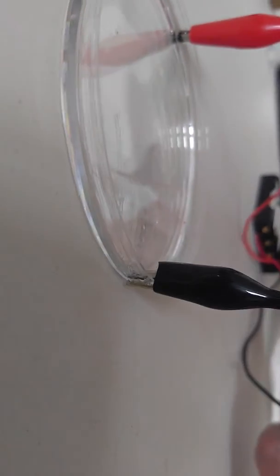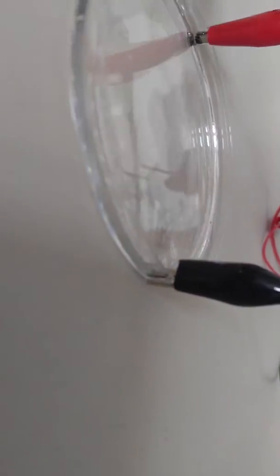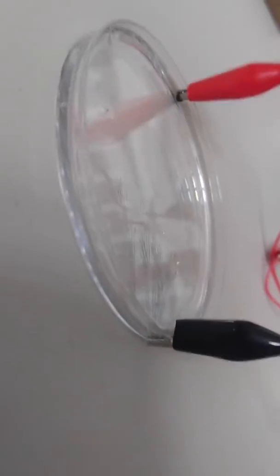Things will stop moving. You see it growing anymore? Mm-mm. Okay, so it's touching it then. No, I mean that one. You're not listening. He disconnected it from the battery, so it's the same thing. It's touching it. Thank you.